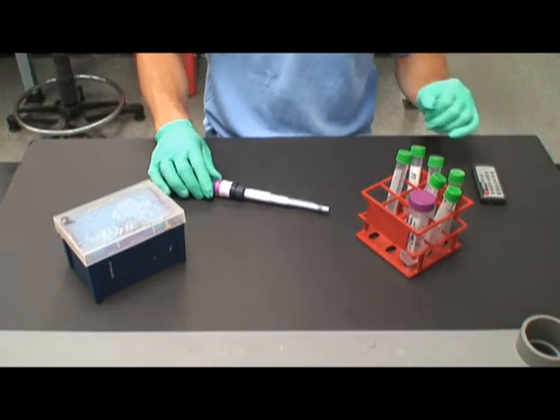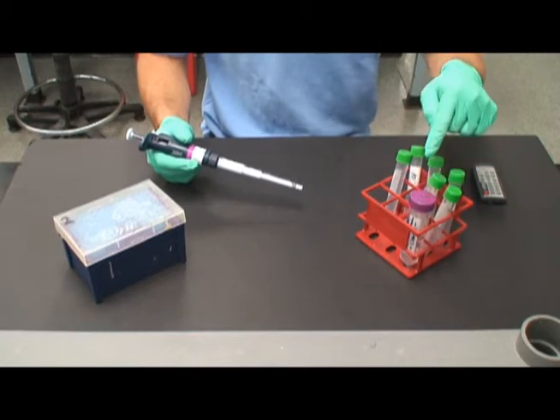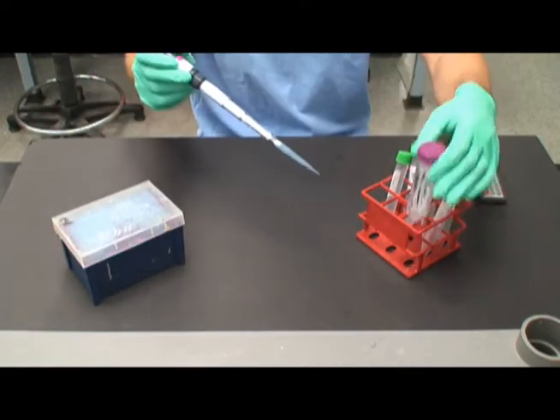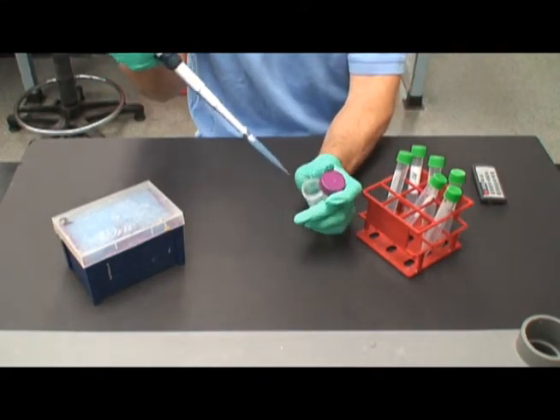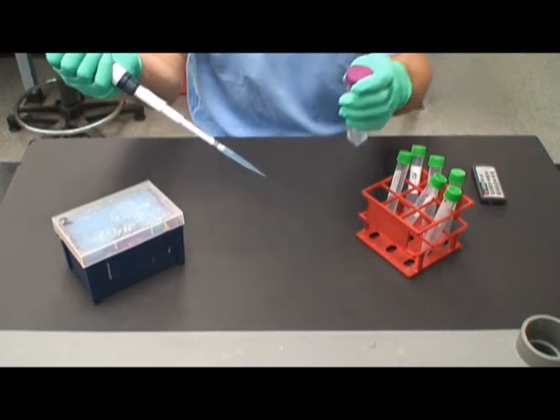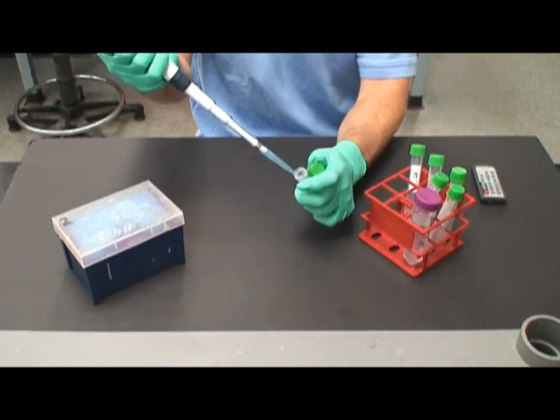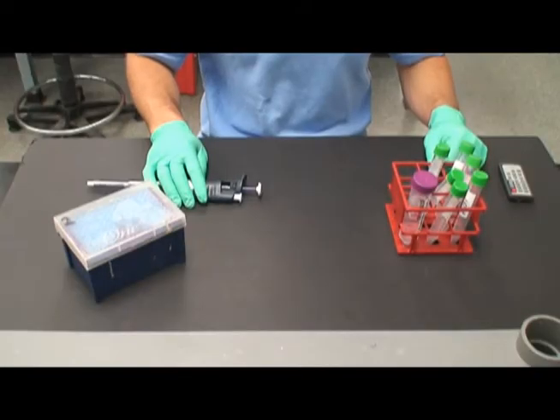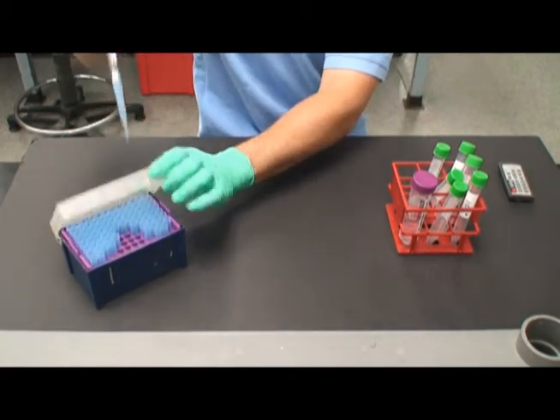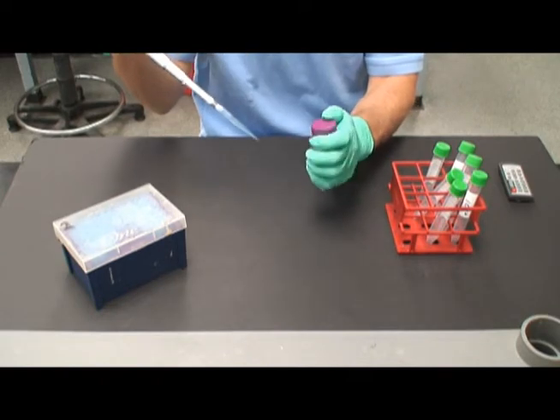Next, with the use of the micropipetter, aseptically transfer 990 microliters of sterile suspension medium into the 10 to the minus 2 and 10 to the minus 4 tubes. Remember to practice sterile technique, only opening test tubes when needed, and immediately dispose of micropipette tips after one use. For the remaining 4 tubes, the 10 to the minus 5, 6, 7, and 8 dilution tubes, we are going to transfer 900 microliters or 0.9 milliliters of sterile suspension medium into each one.